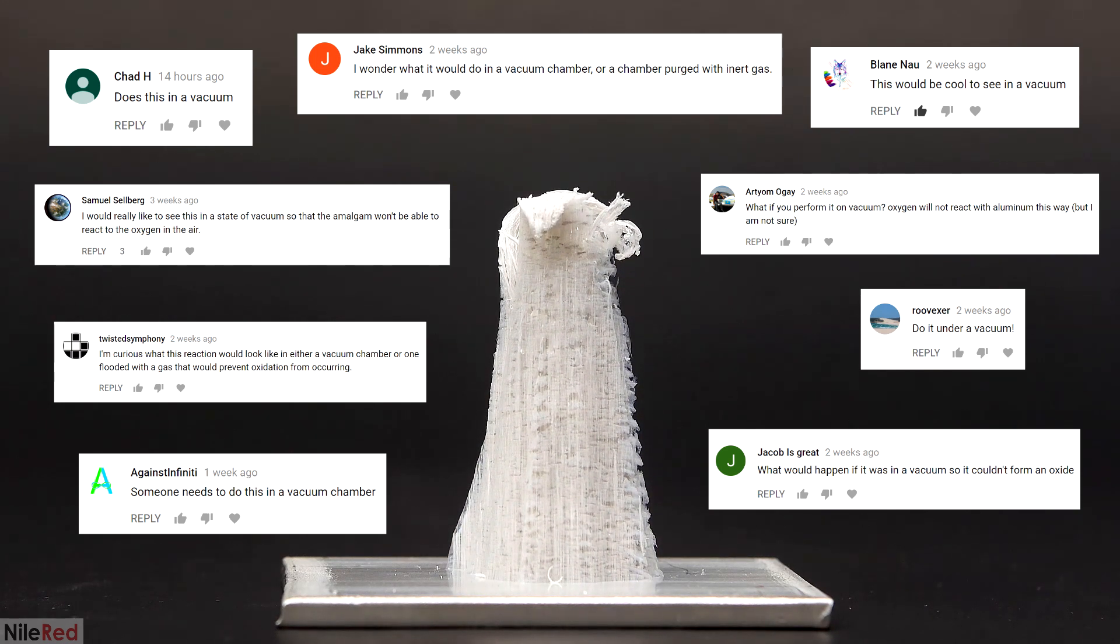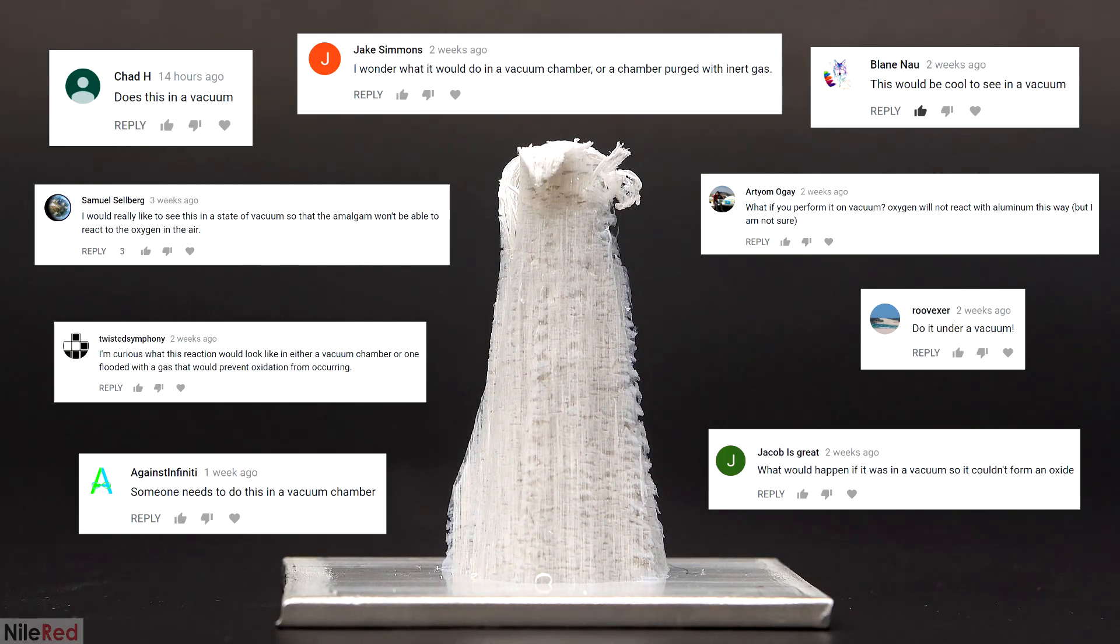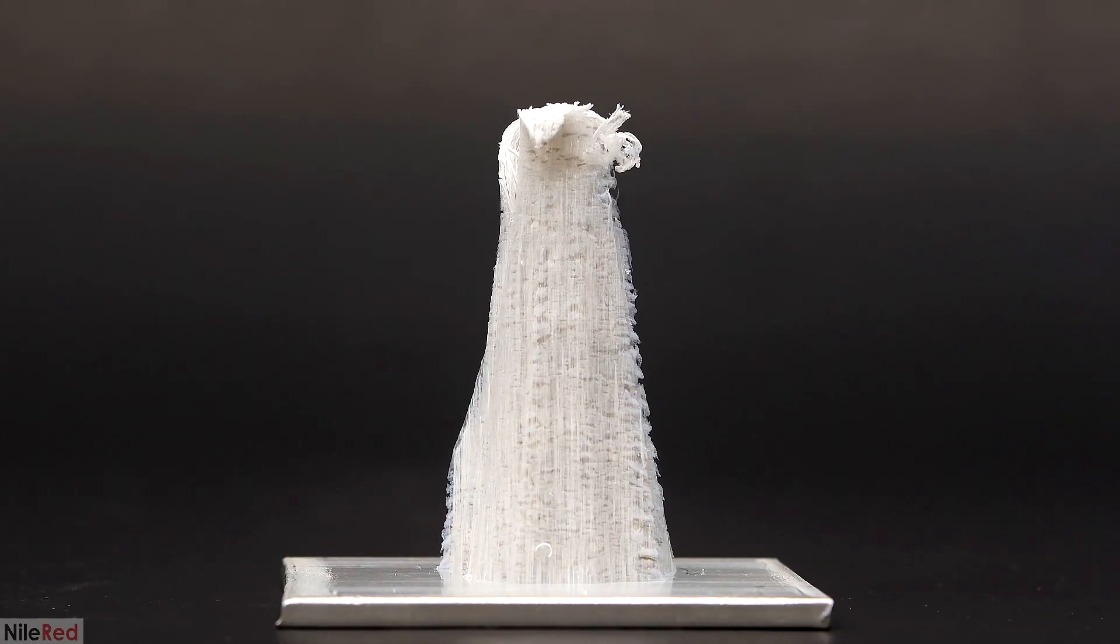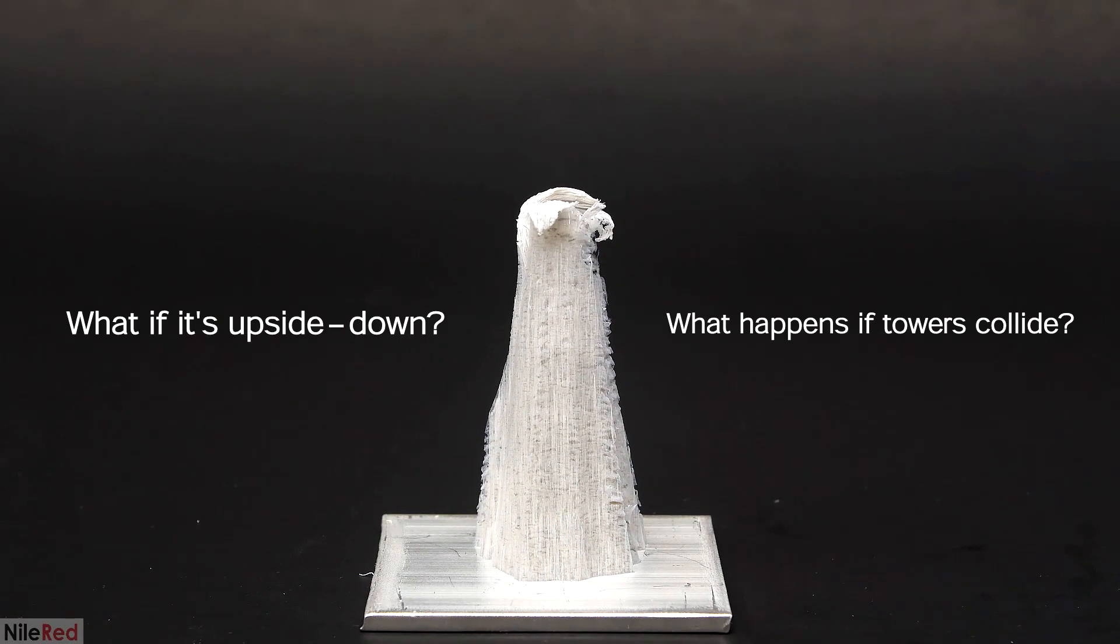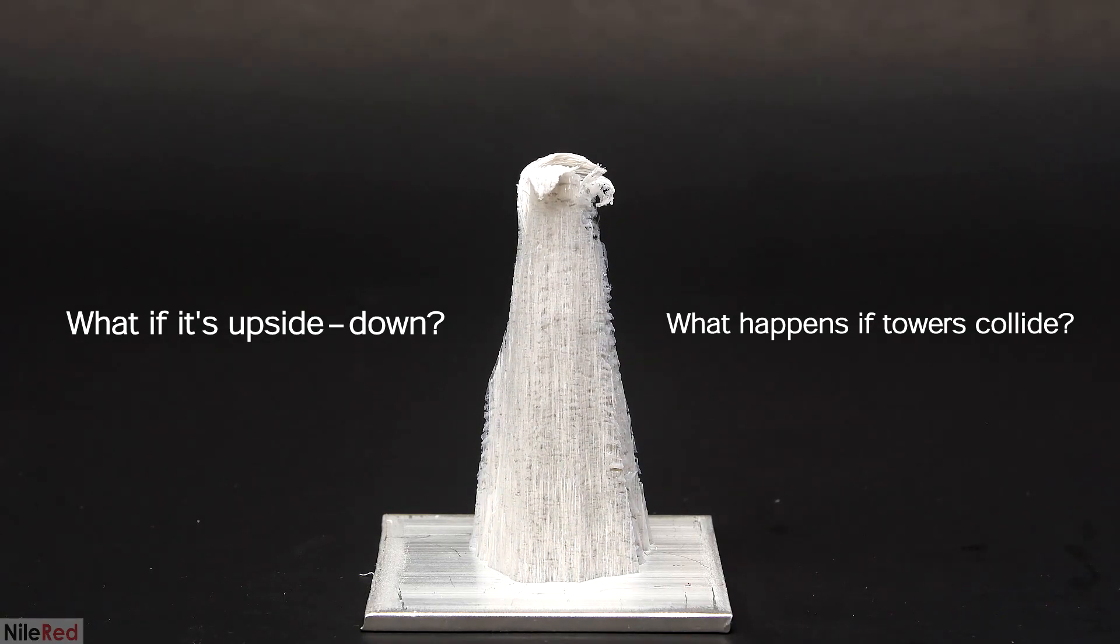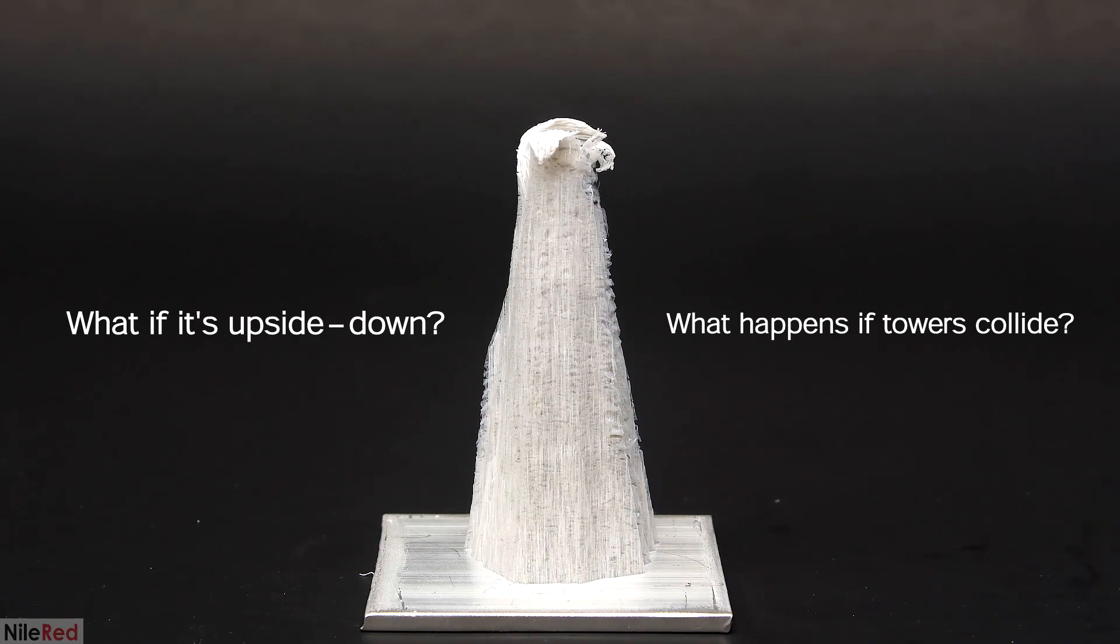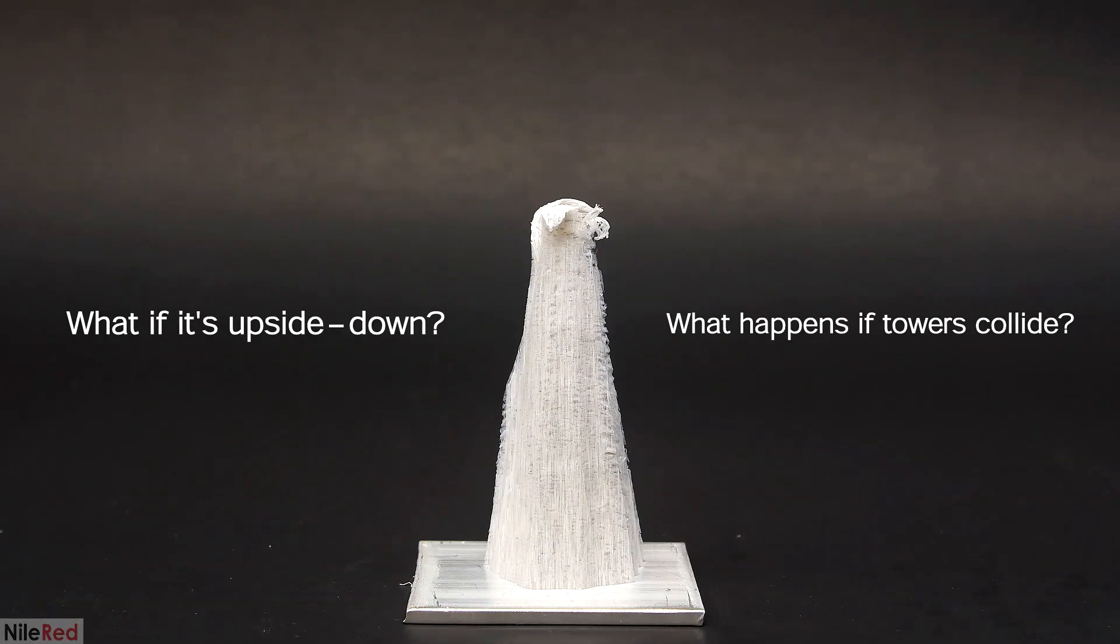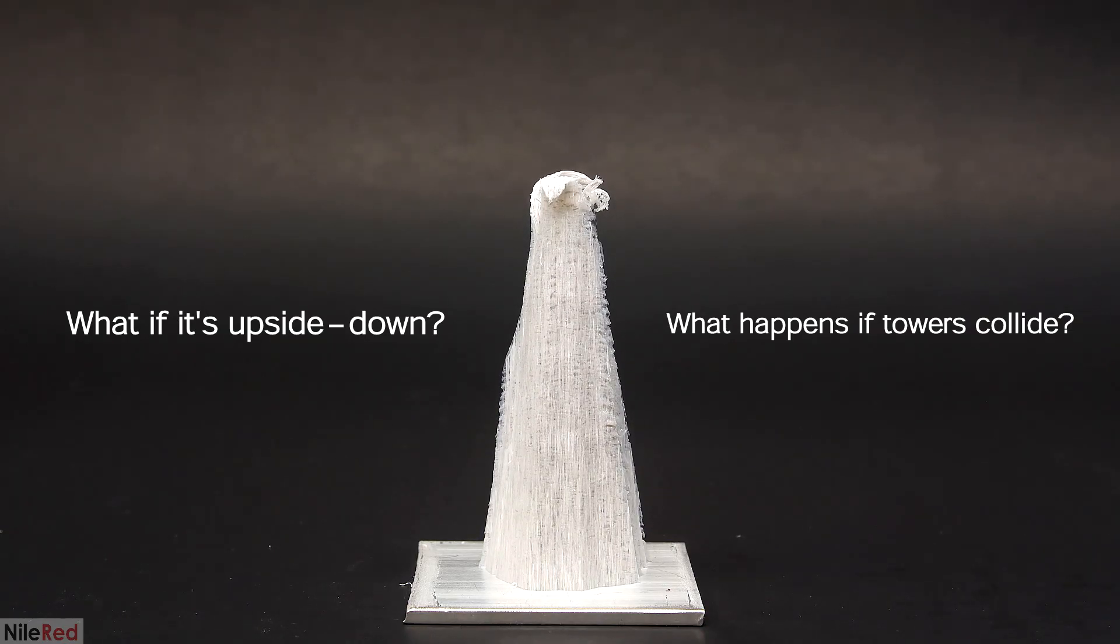Well, in theory the reaction should stop, but it's definitely something worth trying out. There were two other questions which were less scientific and mostly just out of pure curiosity. What if we tried this reaction upside down or if we did it in multiple spots at the same time and had the towers collide? I'm gonna answer all these questions, and I'll start with the most popular one which is to see what happens when I take the air away.